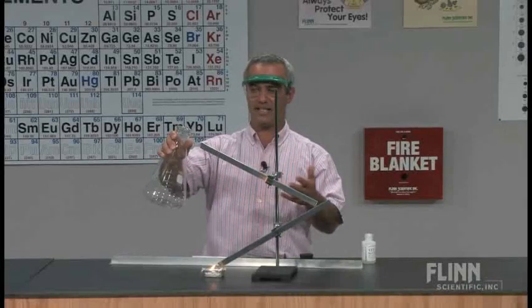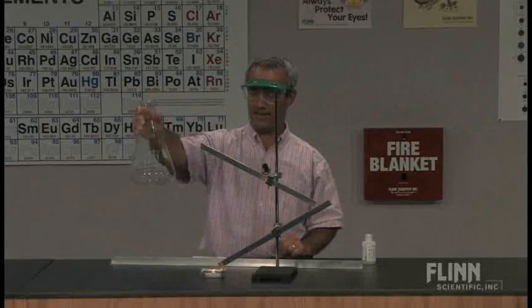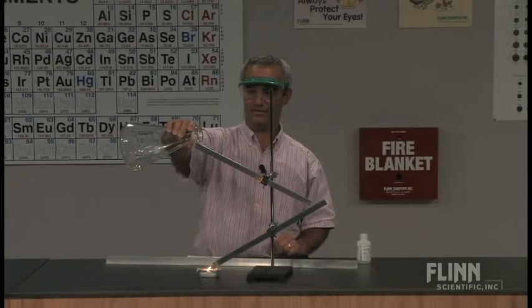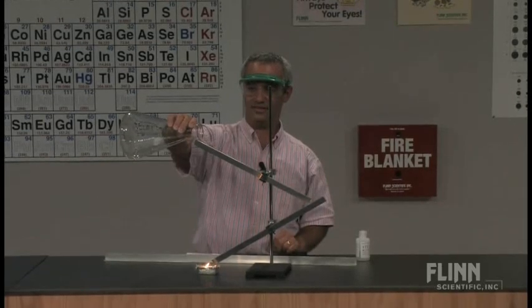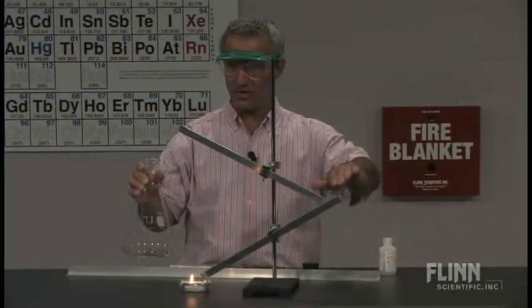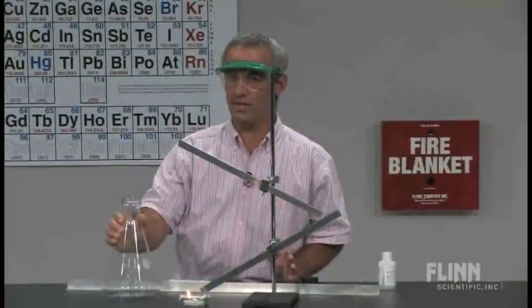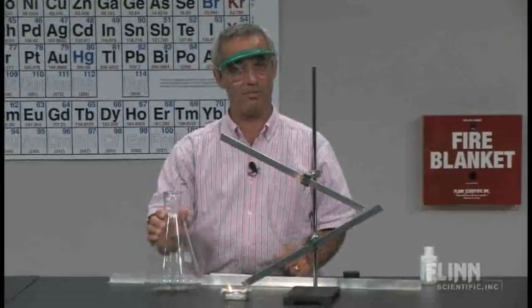Same idea, light's about maybe halfway down, and I've got still enough liquid in there to generate enough vapors, so I'm just going to pour this. It's going to work for me. There we go. Okay, the delay takes a while for those vapors to travel down there, and they're getting diluted during that time. So the flaming vapor ramp, a wonderful illustration of density, of combustion, volatility, vapor pressure. It's got it all built into one. Thank you.